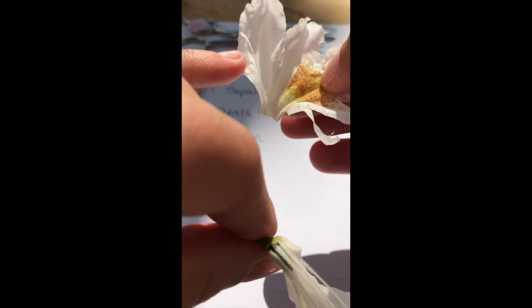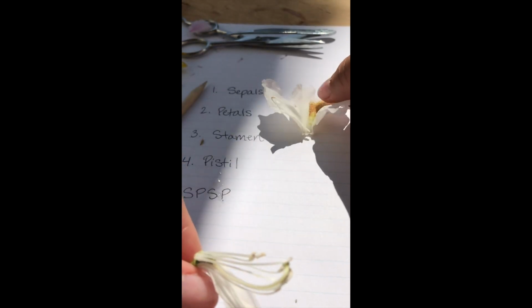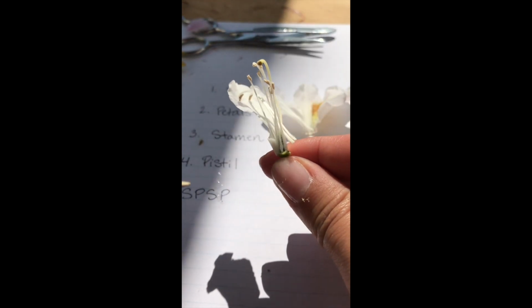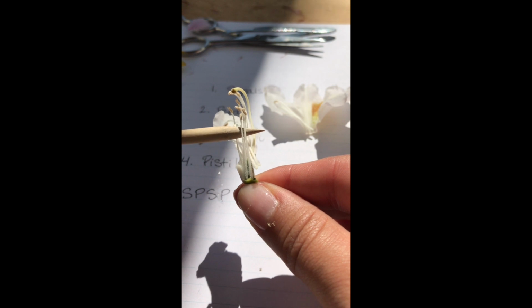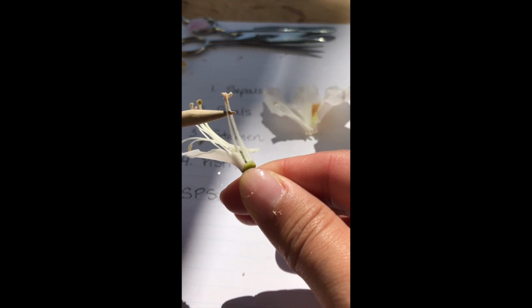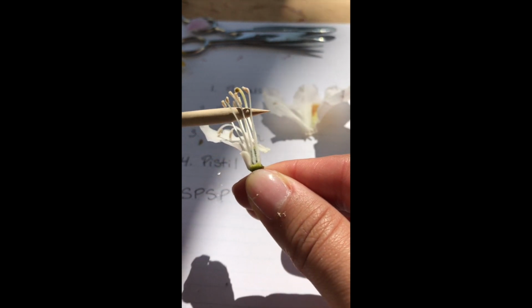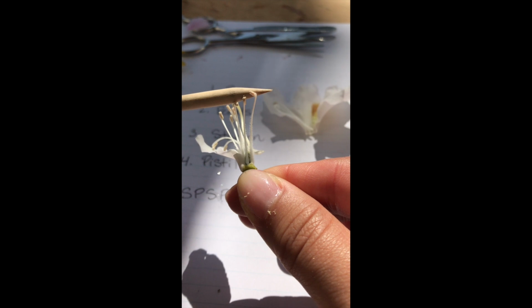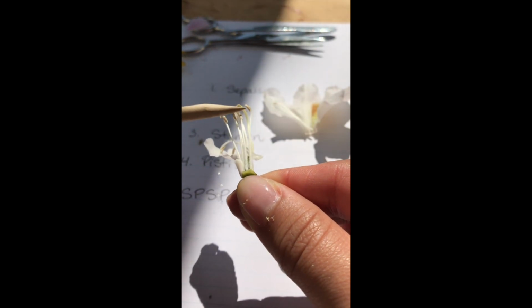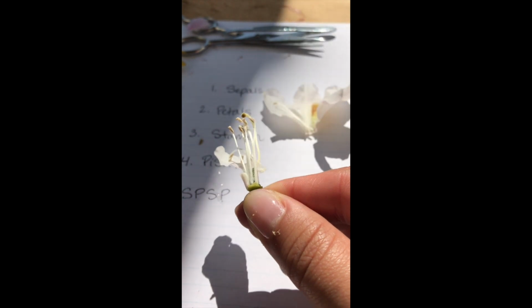So it looks like I lost one little flower part on the inside of that petal, but most of the petals are off. You can see, again, this is a lot bigger than the last flower, but these long stem looking things, these long white stems with little ends that almost look like little white tails or something like that. Those little white tails on the end are the pollen. Again, pollen's at the top, which means that these long pieces are the stamens. So there's those outside of the flower.